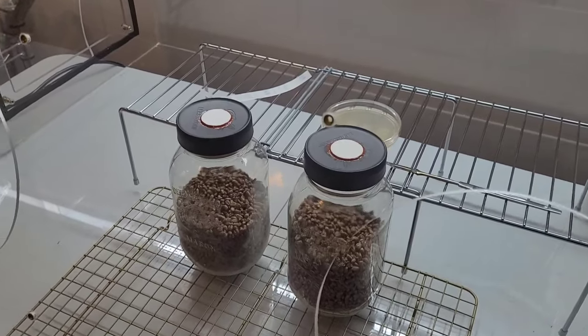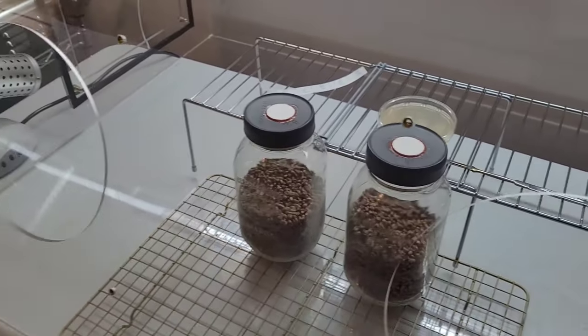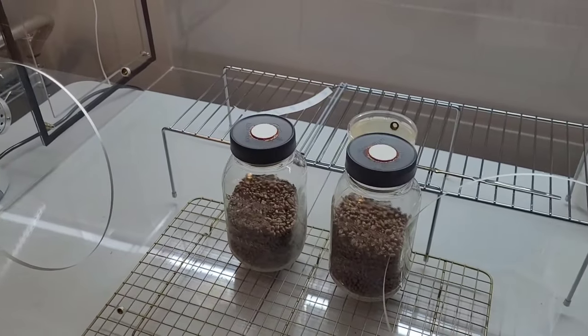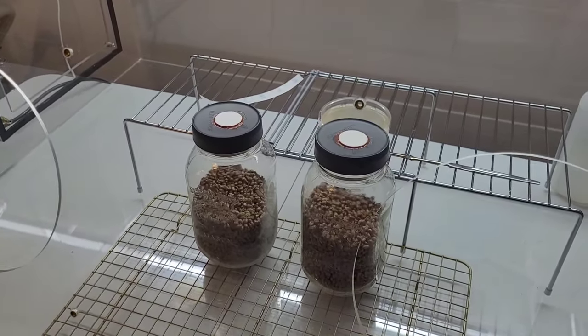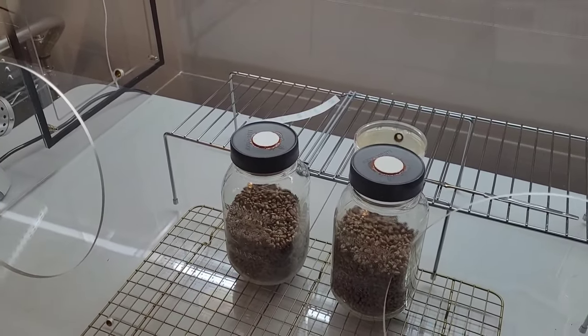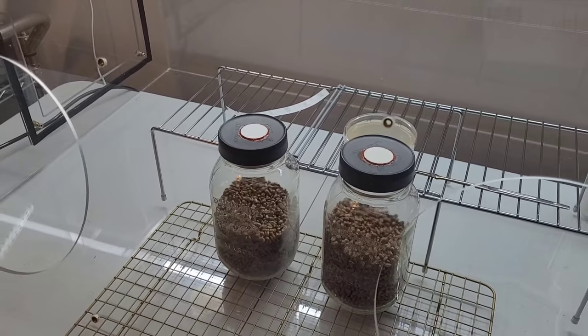So if you ever have the inclination to modify your still air box either with gloves or with some sort of blower system, filters, etc., think to yourself: why am I spending money to defeat the purpose? It's not making anything better. It's actually making it worse.